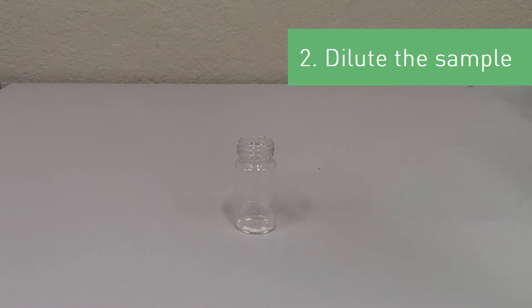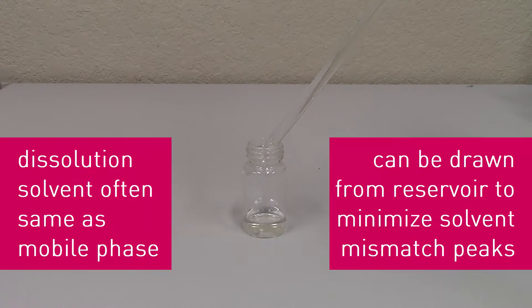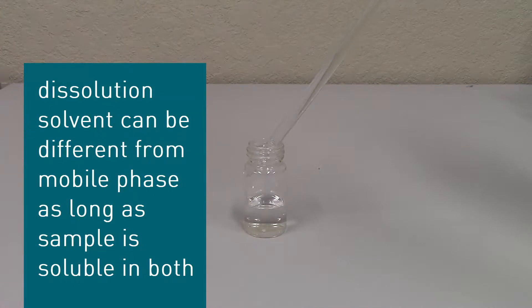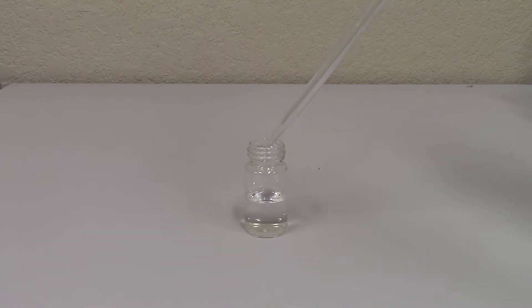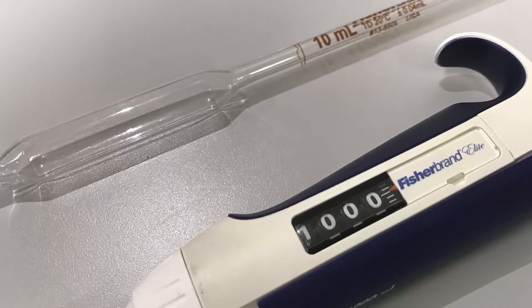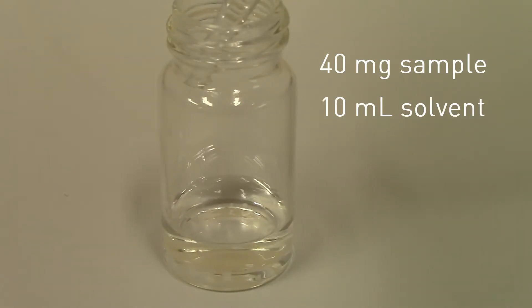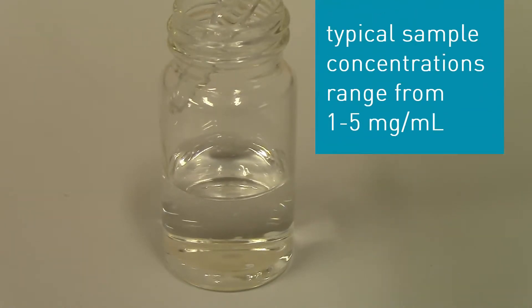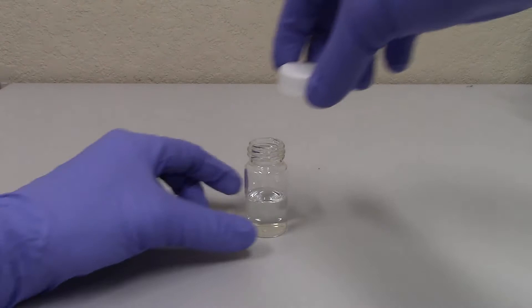The second step is to dilute the sample with the dissolution solvent. The dissolution solvent is often the same as the mobile phase and can be drawn directly from the mobile phase reservoir. This will help minimize solvent mismatch peaks in the chromatograms. In some cases, the dissolution solvent is different than the mobile phase — that's okay, as long as the sample will remain in solution in the mobile phase once the dissolution solvent has been separated away. Since the mass of sample is known, it is important to use a pipette or other graduated liquid dispenser to add a specific volume of dissolution solvent so that the exact concentration of sample in solution can be determined. For instance, if 40 milligrams of sample was weighed out, then using 10 milliliters of dissolution solvent would produce a sample solution with a concentration of 4 milligrams per milliliter. Let the amount of sample available and desired concentration dictate how much dissolution solvent to use. Gently dispense the dissolution solvent into the scintillation vial containing the sample and secure the cap.